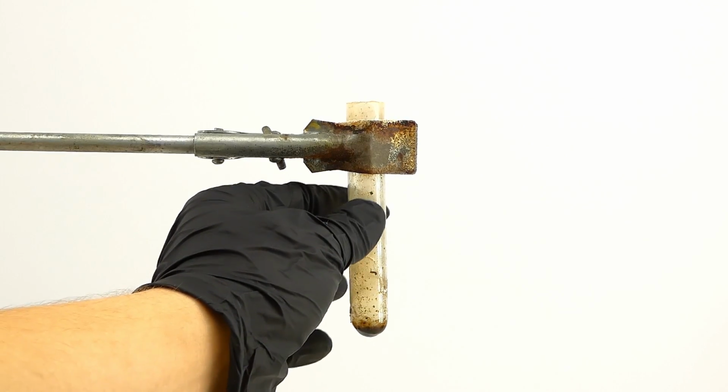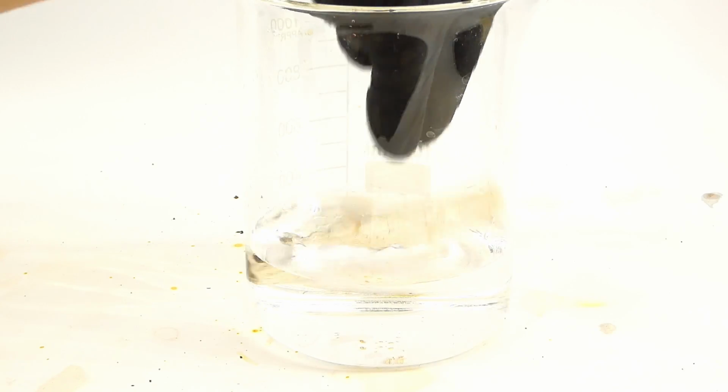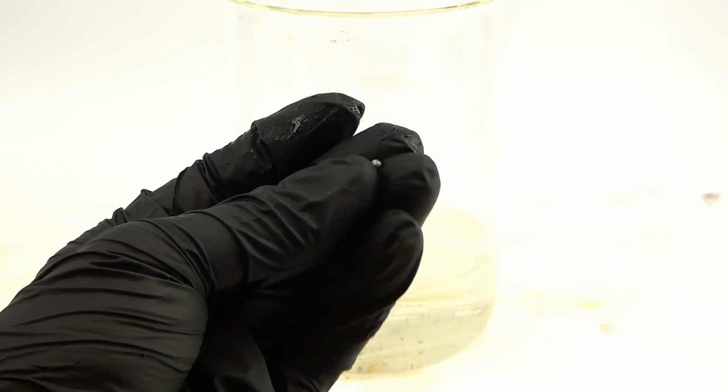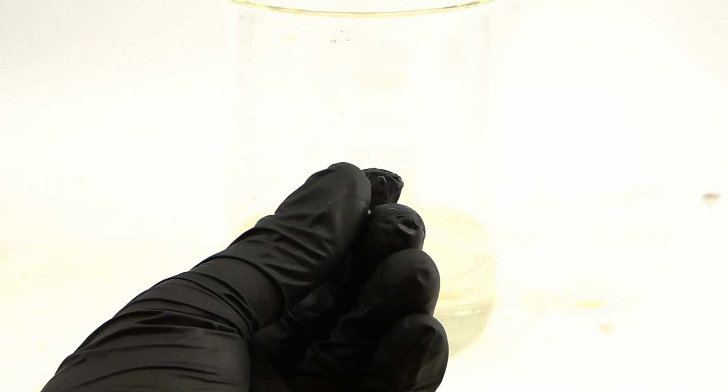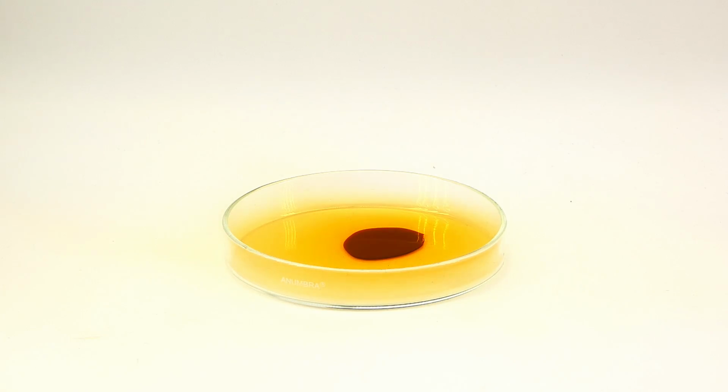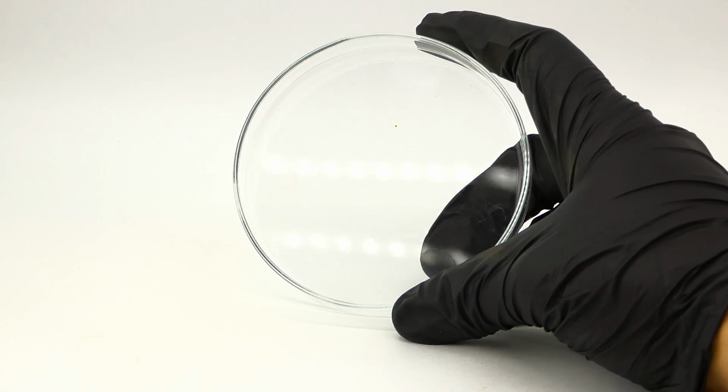When the reaction finished, I put the test tube into some water to dissolve the aluminum bromide and recover this nice small ball of pure aluminum that melted from the high heat of the reaction. For the next experiment, I want to show you just how quickly bromine evaporates, so I put a small amount of it onto a petri dish, and after a few minutes of producing copious amounts of vapor, it was gone.